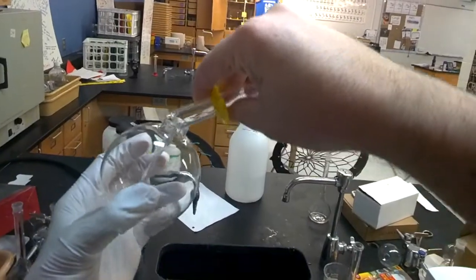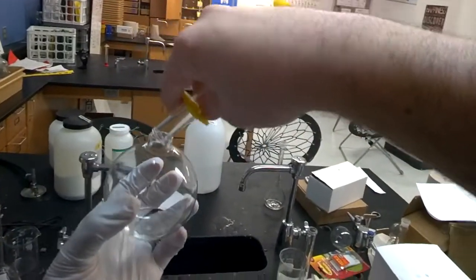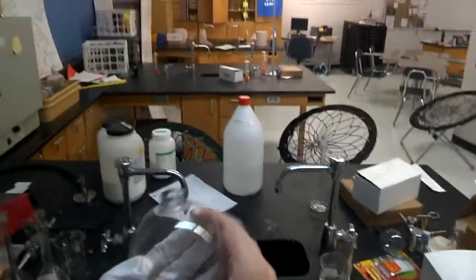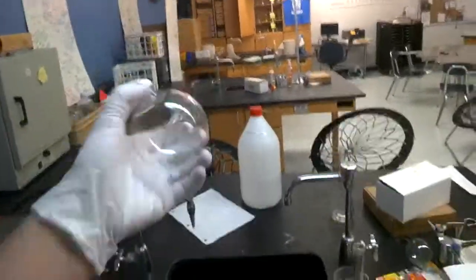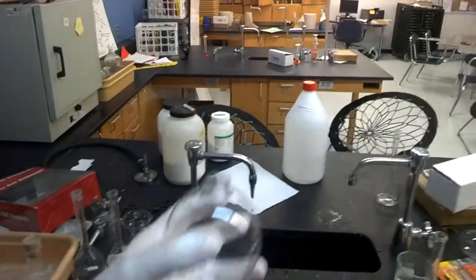So I'm going to add my dextrose to the inside of my container and what I'm going to do is I'm going to put my thumb over the top. Notice the gloves. I'm going to put my thumb over the top and I'm going to give that a good swirly swirl so that it's completely covering everything on the inside. I found that when you swirl you get a better result.